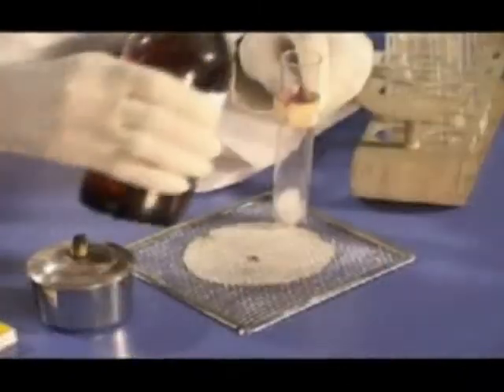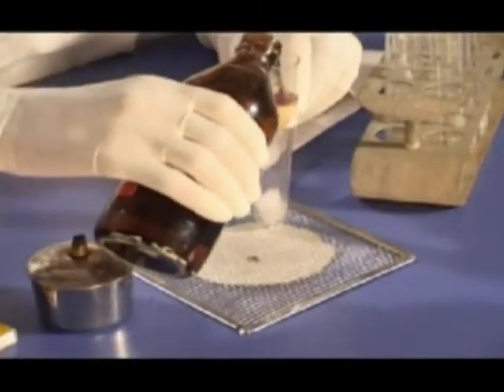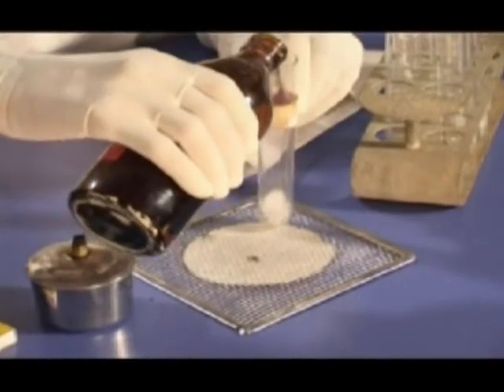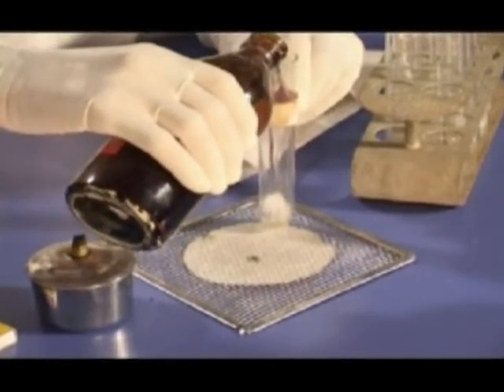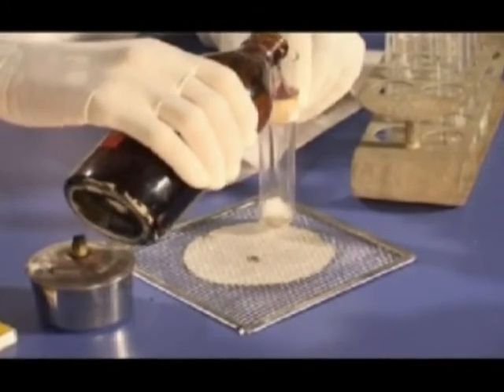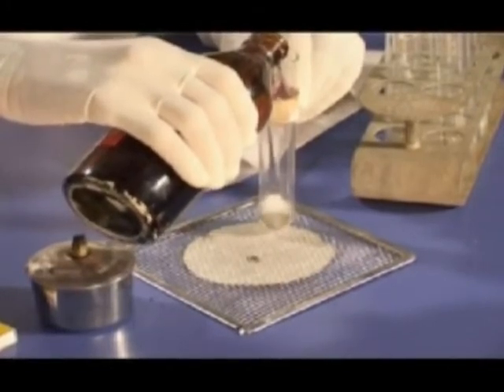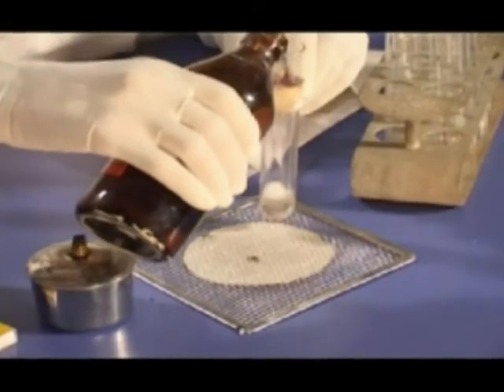Step 3: Treat the fiber with cold formic acid. If soluble, the fiber is nylon. If the fiber is insoluble, go to Step 4.